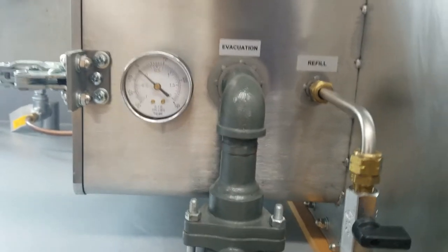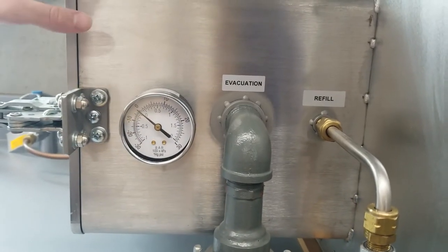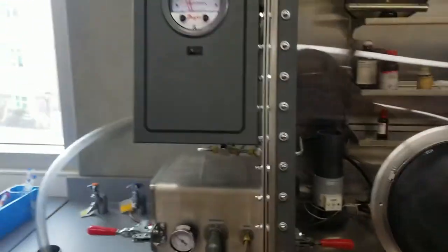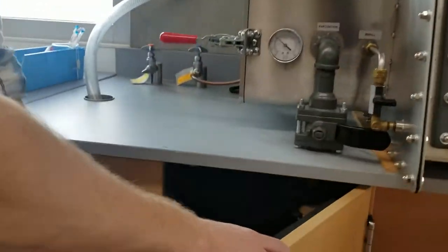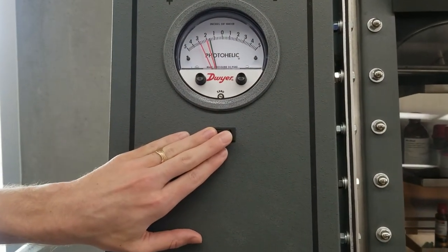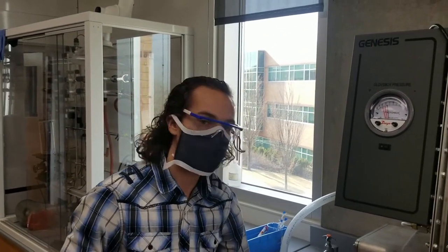And we want to make sure that the antechamber is open to an atmosphere, so we have it open to the inside. I mean, has been refilled to an atmosphere, so it's not under vacuum. And then we'll just come down here, to the vacuum, or, well first actually we're going to turn off the glove box. And we're going to come down here, and we're going to shut off the vacuum. That's how you put the glove box on standby, or shut it down. And if you're going to shut it down for long term, make sure to turn off the gas too.